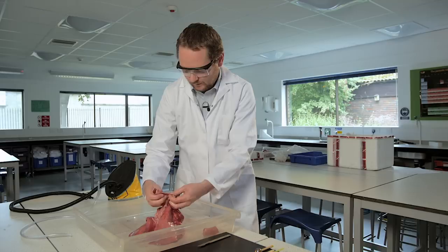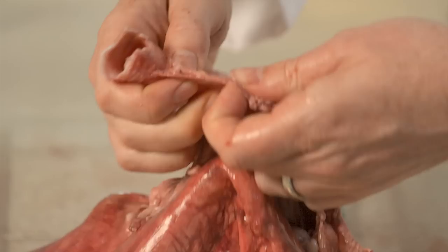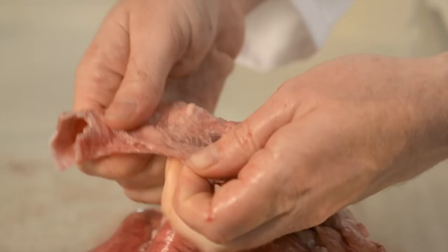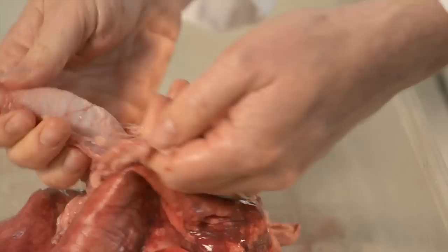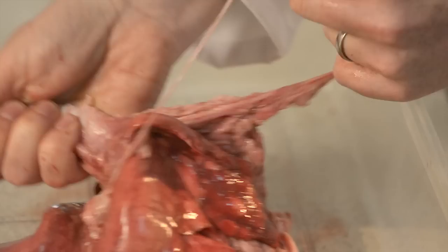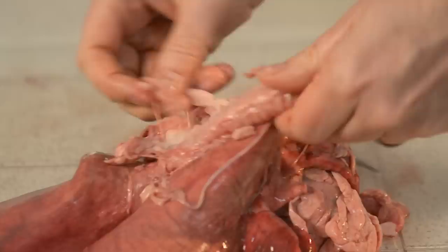Once they've got their orientation, we can start looking at where does the trachea go. The trachea has a load of connective tissue around it. Interesting thing to bring up the connective tissue, we don't really talk about it very much in biology, but it's a fundamental part of keeping everything where it is in the body. So things don't rub against each other. So we can pull it apart and see that the trachea is being held, obviously not held in place because we've taken it out of the organism, but it would be held in place by this connective tissue.